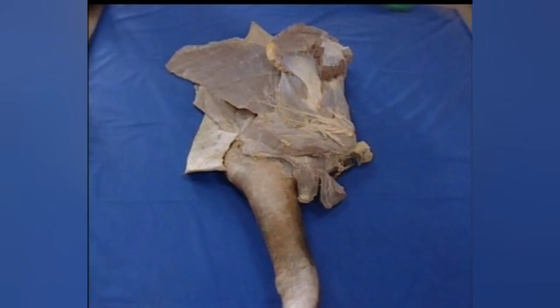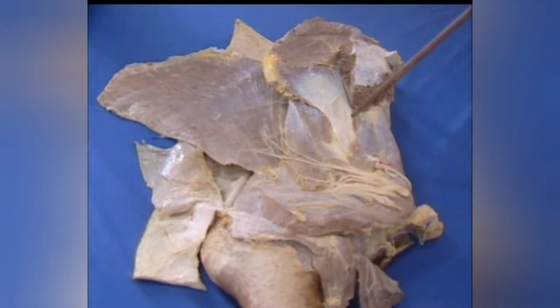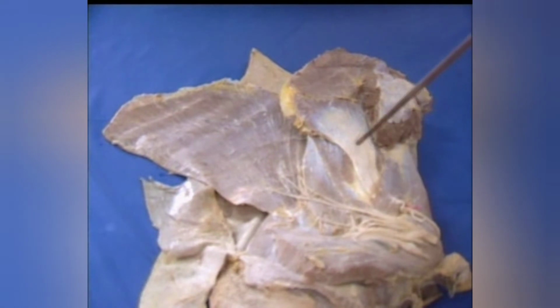Now, the forelimb has been removed by cutting the insertion of trapezius, serratus cervicis, serratus thoracis, rhomboideus, brachiocephalicus and omotransversarius in front of the shoulder joint. This region is the shoulder region, which is formed by the scapula. This aspect is the medial aspect of the shoulder.